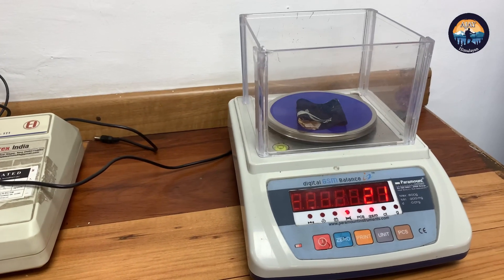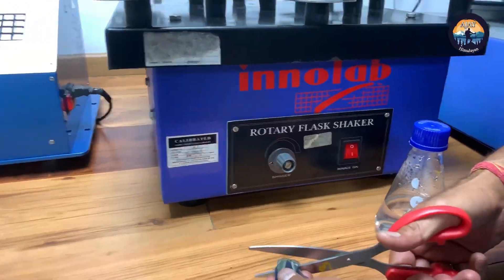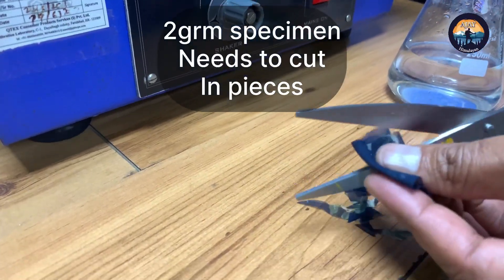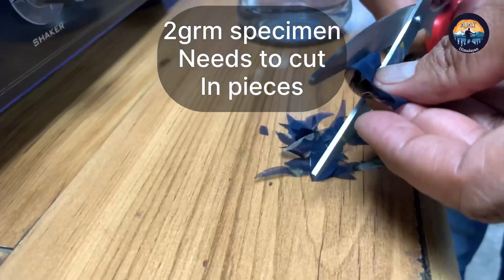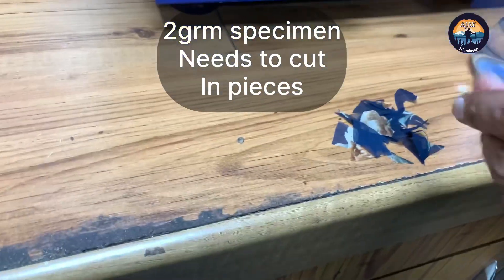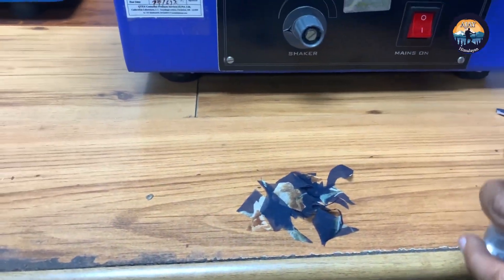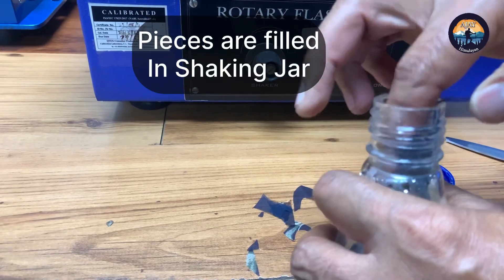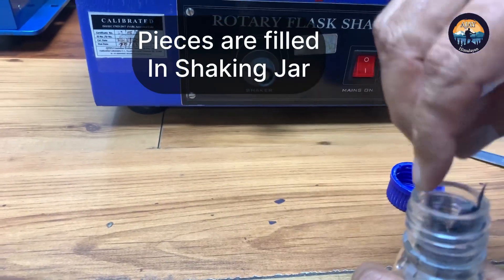This is the meter to read the grams. Now this specimen needs to be cut into small pieces, then we put these pieces in the jar to shake them.